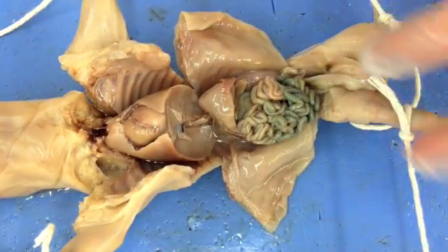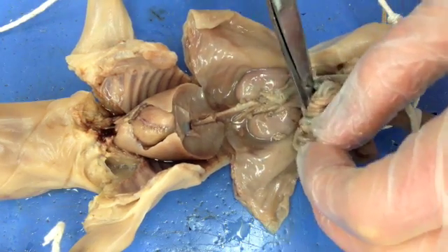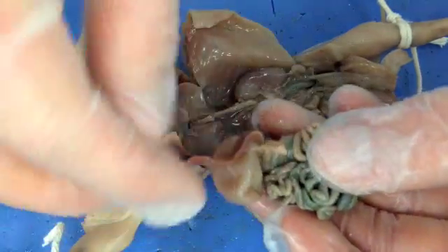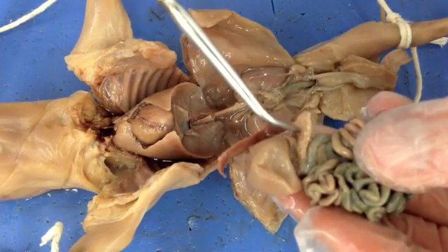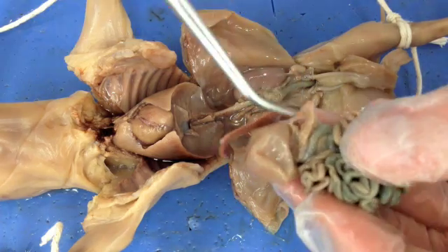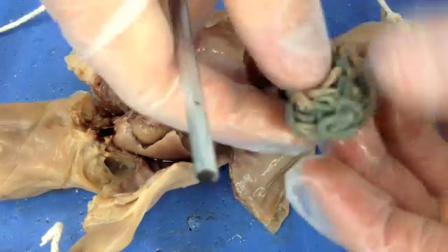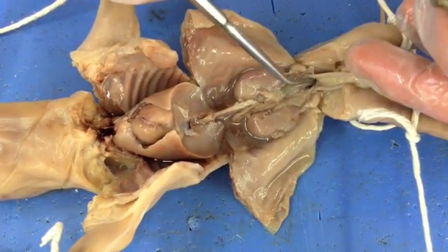So what I have removed here — let's identify: this is going to be the spleen, and underneath it is the stomach. This right here is the pancreas. Individuals who have diabetes — this is the organ that is not functioning properly. And then we have our small intestines, which are all coiled, leading into our large intestines, and then eventually down through the colon and out through the anus.